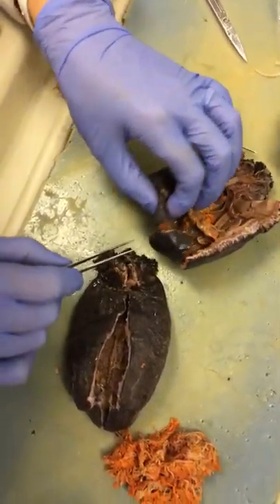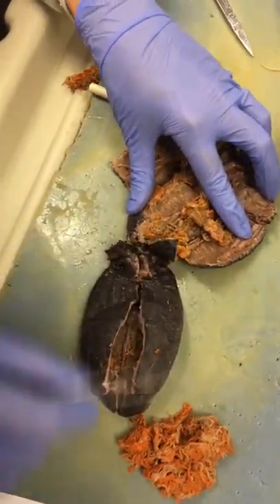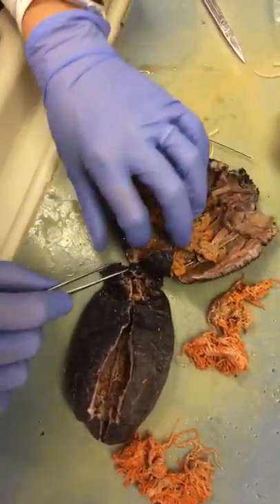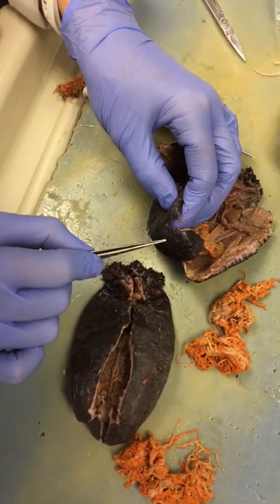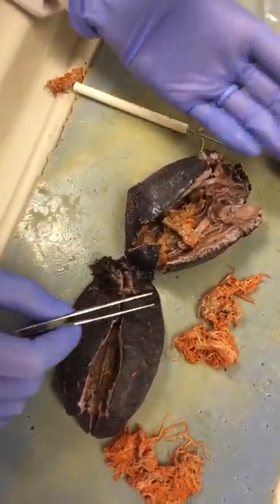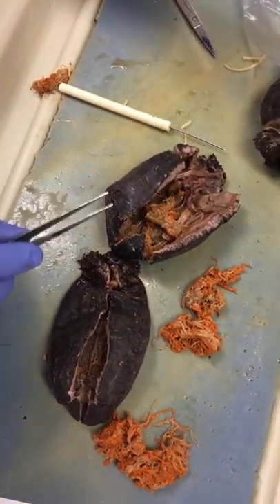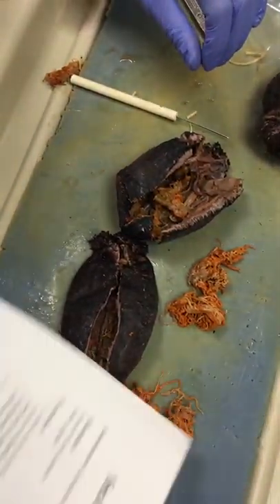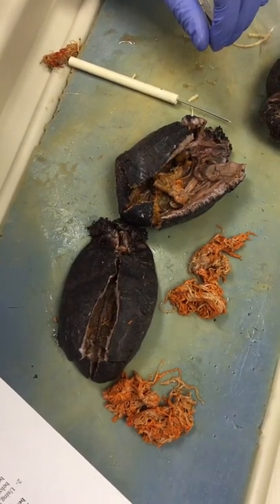During evisceration, where they're going to spit out part of their body, they're going to get rid of things like the gonads and the respiratory tree, and they're going to release that out the anus area. That allows them to escape a predator who might be trying to consume them. That's what you need to know for the sea cucumber.